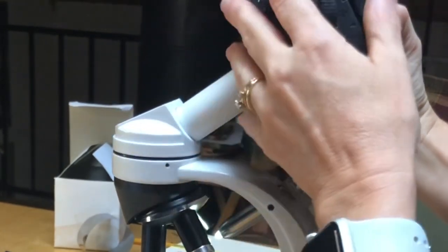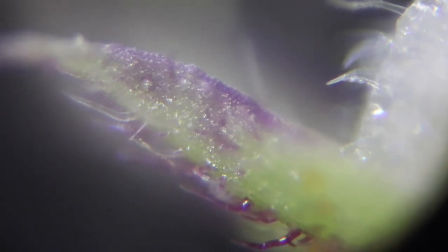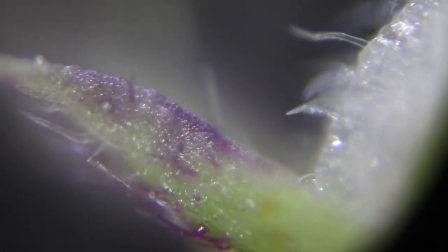This allows you to take pictures with your DSLR. If you are doing a slice of something like a plant, or if you're looking at blood cells or other things, then it's helpful to have the bottom light on because those things are translucent and the light can travel through them. But sometimes when we're looking at something a little larger than that, like in this case parts of a flower, this is part of a plant, or we're looking at an insect or some other things, then that's not quite as helpful and it can actually obscure what you're looking at.